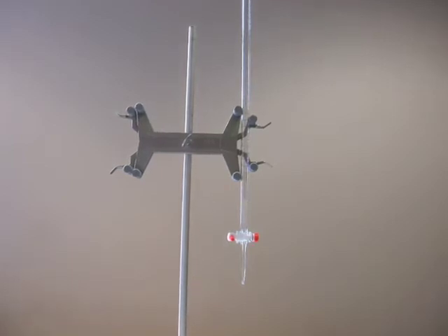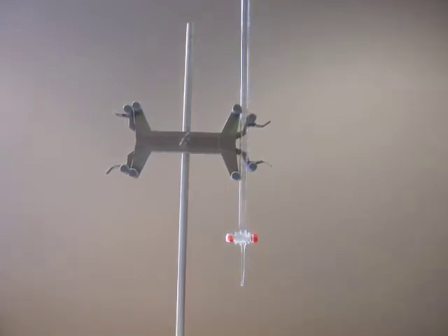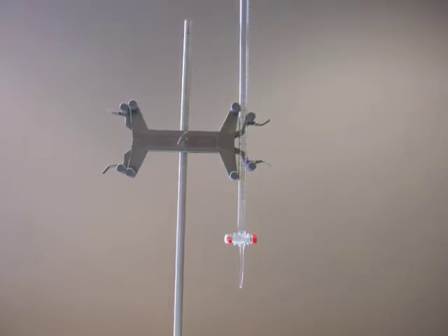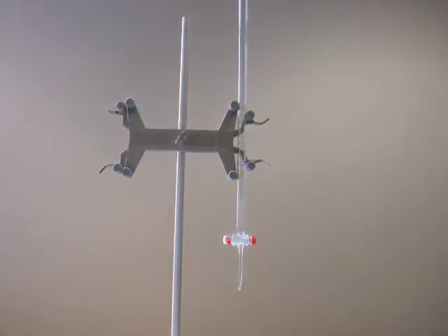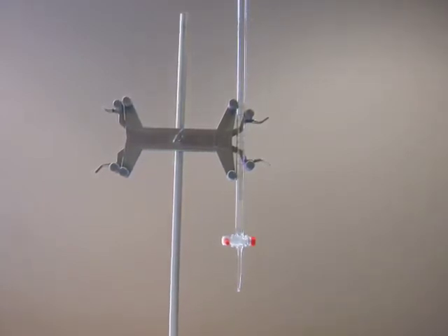This video will cover the proper use of a burette. Look elsewhere for specific information about the chemistry of your particular type of titration experiment.